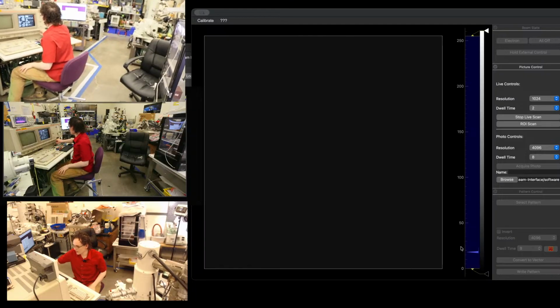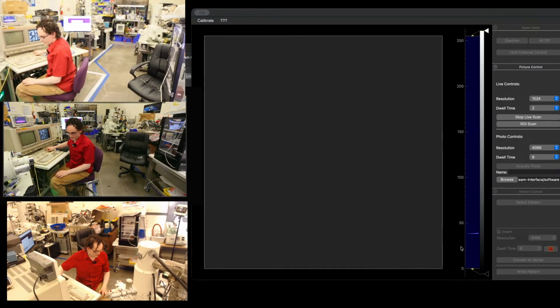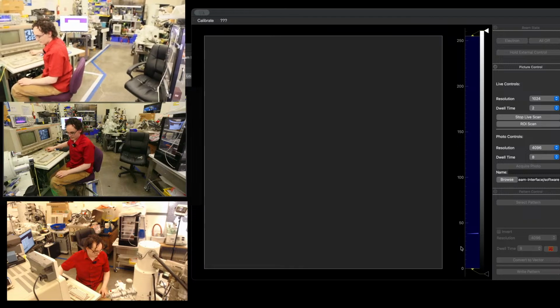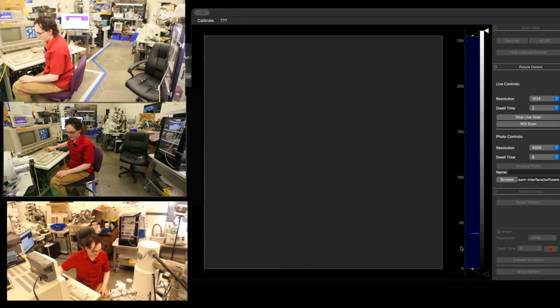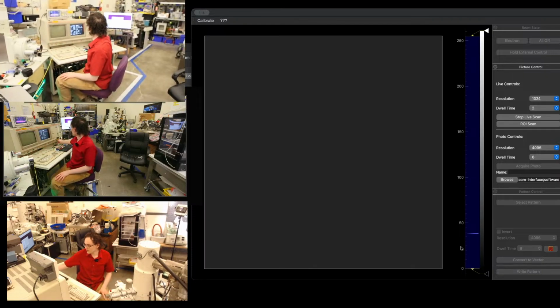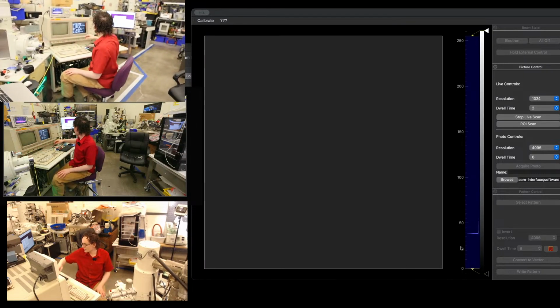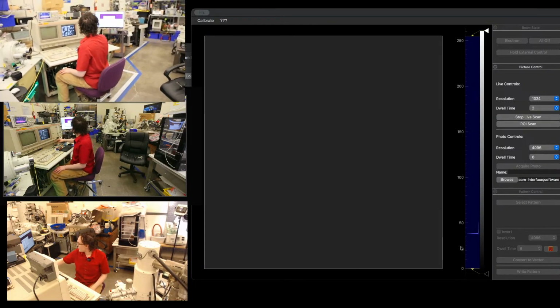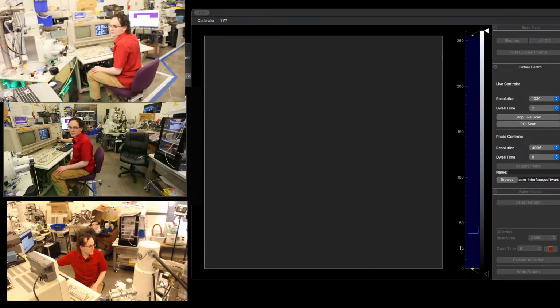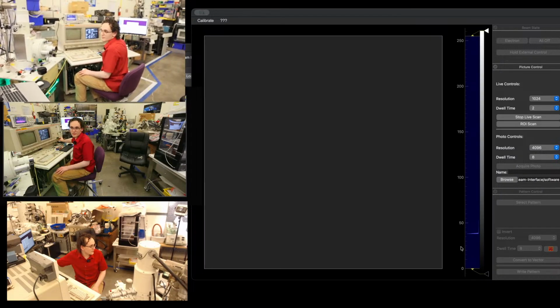High voltage on. Bring up contrast, bring up brightness. Okay, V7 cycled a little bit there, and our current meter is not on, so we got just a second to wait for some air to get out of the system. There we go. Okay, high voltage up. Let's warm our filament up.